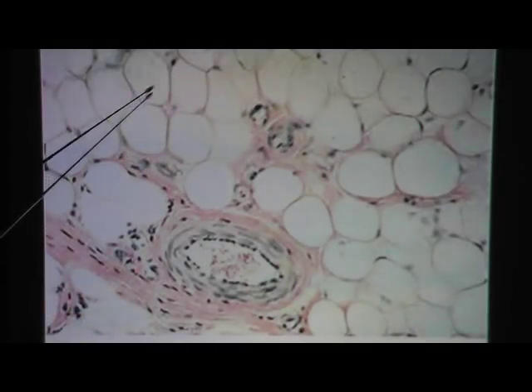Here's another look at fat. It's pretty simple — round structures with not a whole lot of nuclei; here's one, maybe another. The material outside the adipocytes is not part of the adipocyte; it's fibrous tissue, which is also connective tissue but a different kind. In this view, you can also see a blood vessel. Make sure you can identify the nucleus, the cell membrane or plasma membrane, and the fat vacuole.